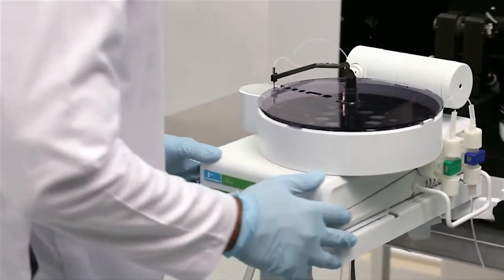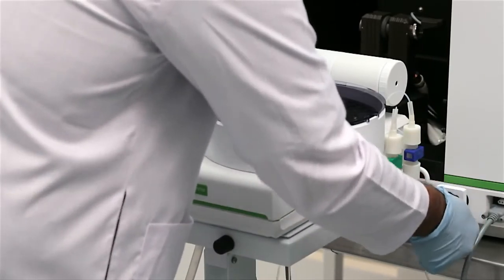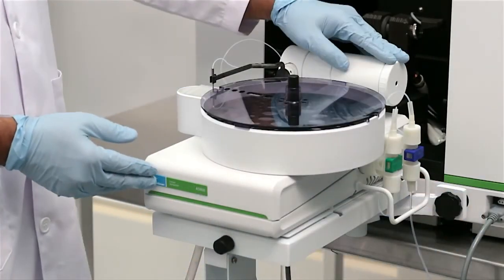Swing the auto sampler in place and lock it in. Check for the alignment and the dispensing height. This is covered in other sections of this video.